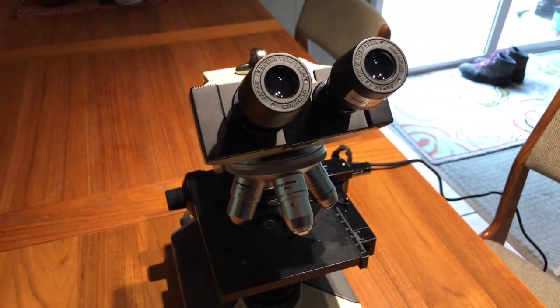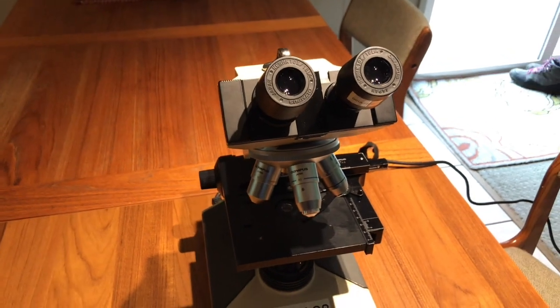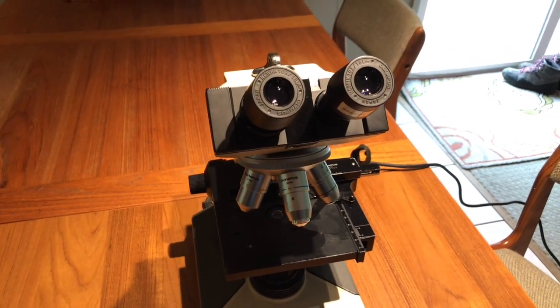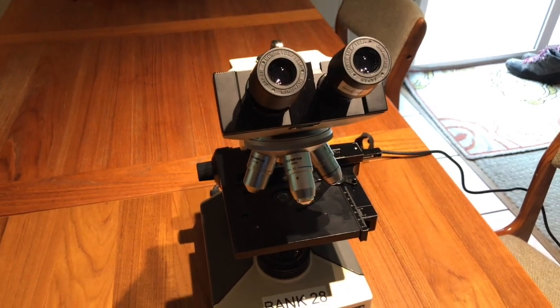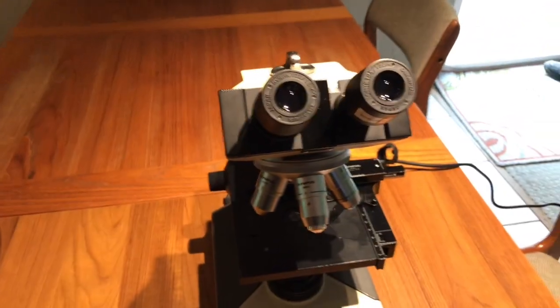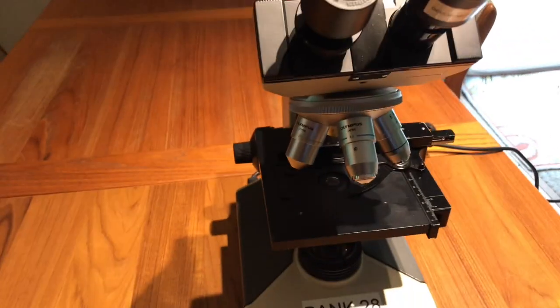One of the things that I want to accomplish with this video is showing you the different ways by which you can adjust the microscope for yourself. I usually like to start from the top and then walk my way down to the bottom of the scope.